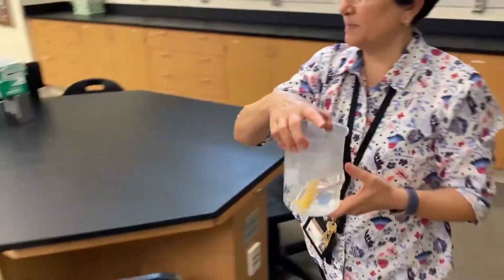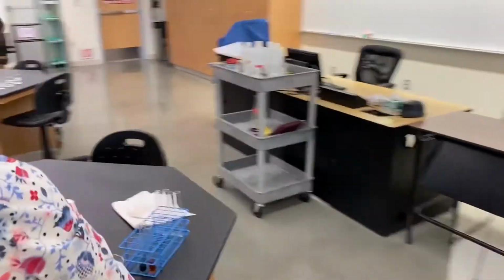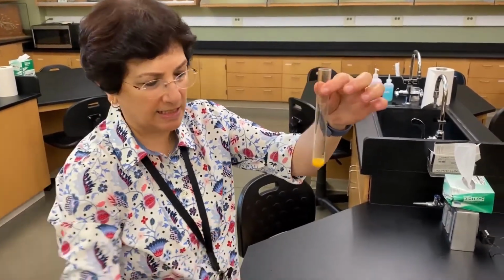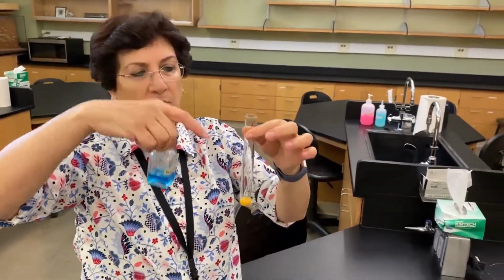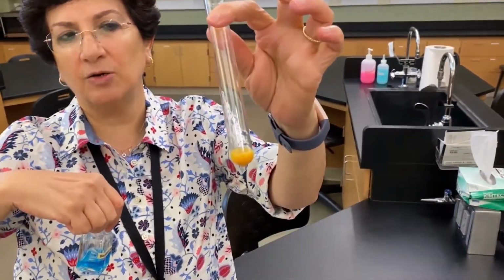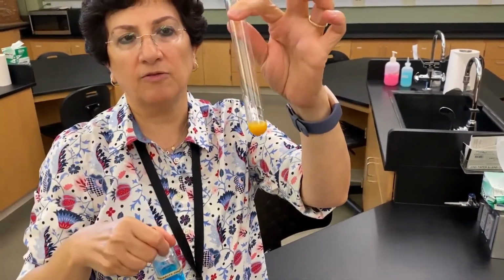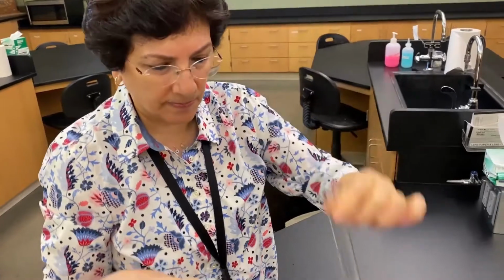So this is the setup that we started with in the microwave. Okay, so let's see. This is the inside, meaning this is the sample that we took from inside the dialysis bag. Remember, this is the original color, that blue color. We added it to our solution and it turned that deep orange color. Again, it really looks like orange juice. So this change in color indicates the presence of glucose. Yeah, we did put glucose inside the tube, so we expect to see this color.